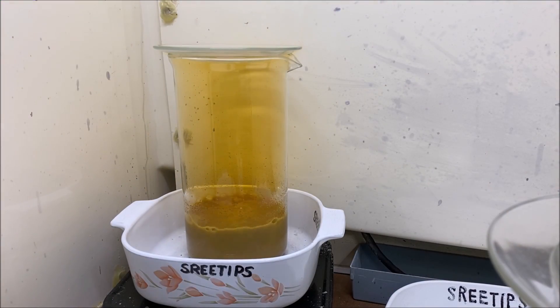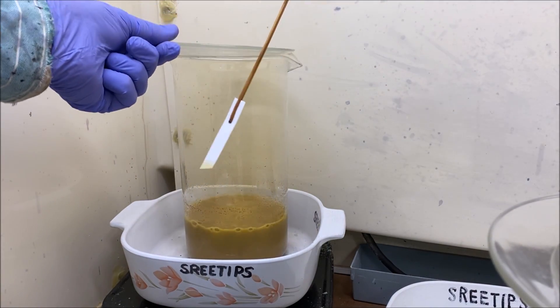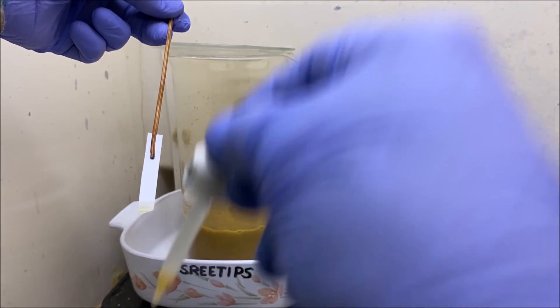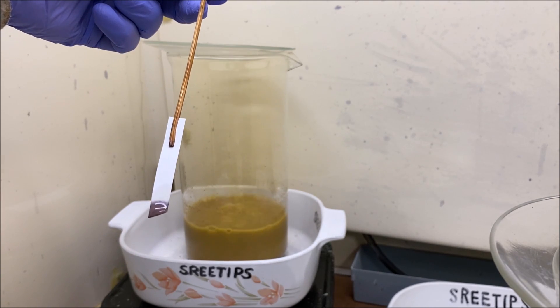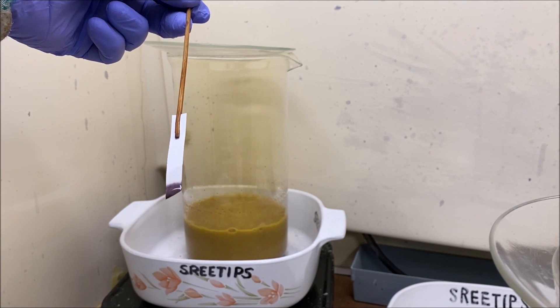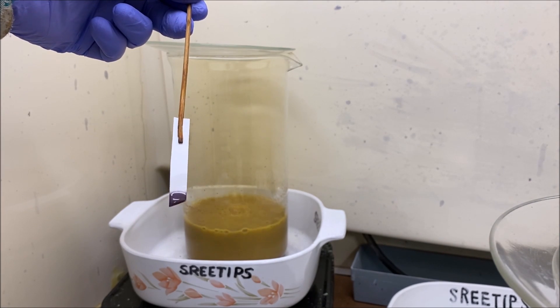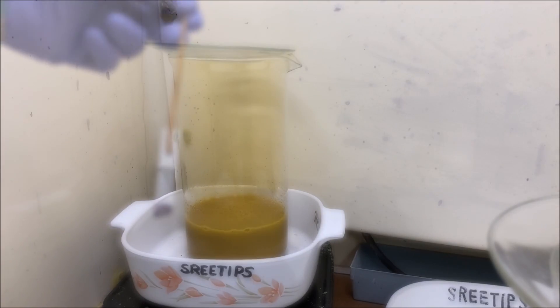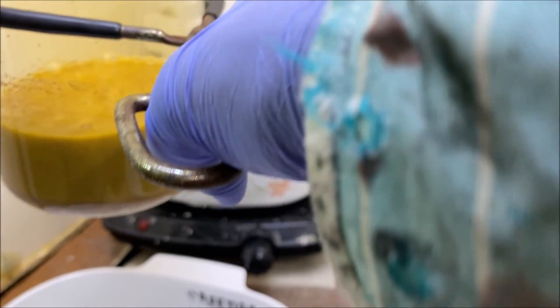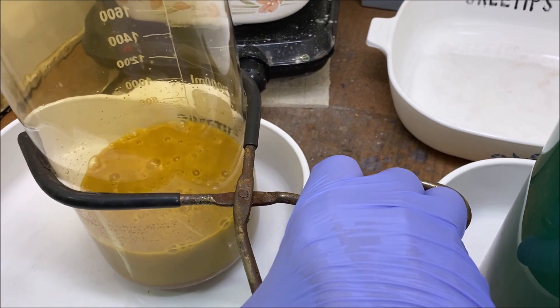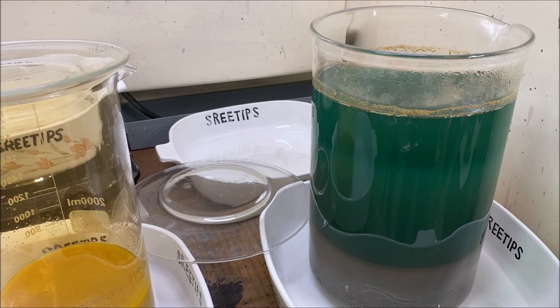I've had the solids on boiling now for a couple hours. Let's get a sample on a piece of filter paper here. Let's see what we got going on in this solution. And you can see we've got a dark stain. So there's probably a couple of grams of gold still in that solution. Let's pull this down off the heat, let it cool down. Let's go ahead and siphon off some of this rinse water.